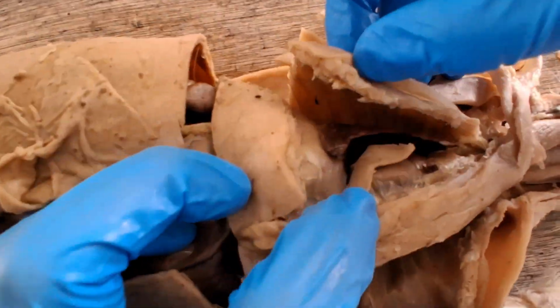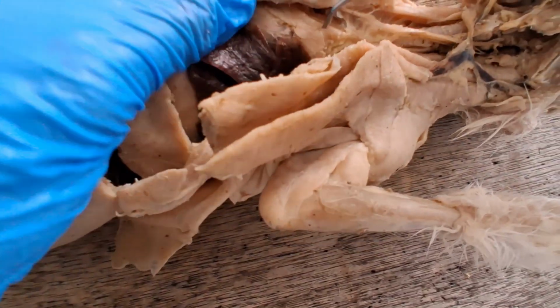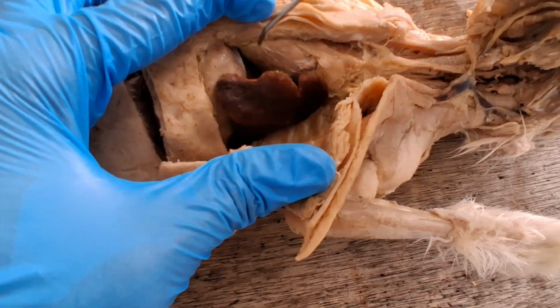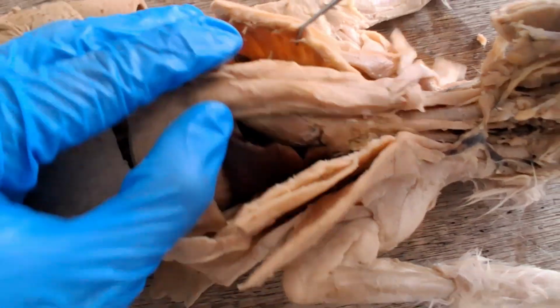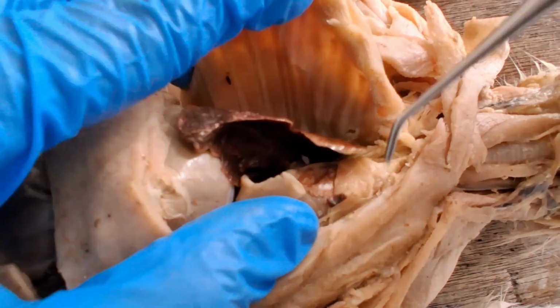So now these are the two pleural cavities, left and right. So air coming from the trachea goes down here, and the trachea will split into two primary bronchi, and then will split into many bronchioles, and then eventually reach the alveoli of the lungs for gas exchange. So there's a right lung, left lung. Okay. And then there are lobes of the lung.